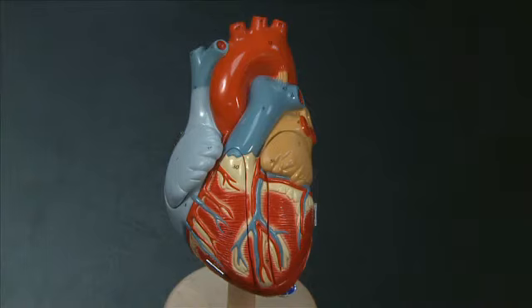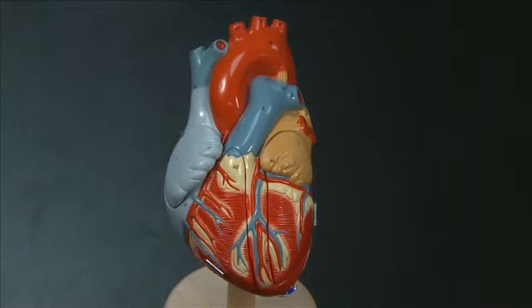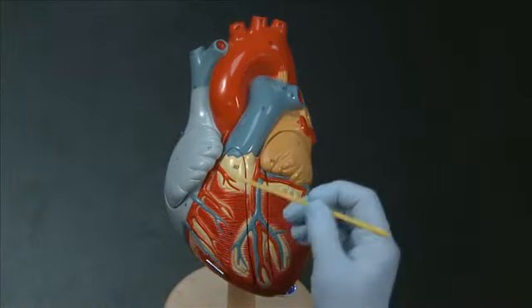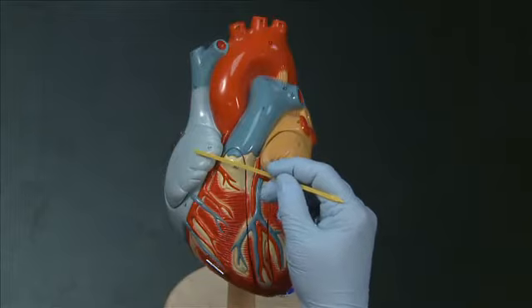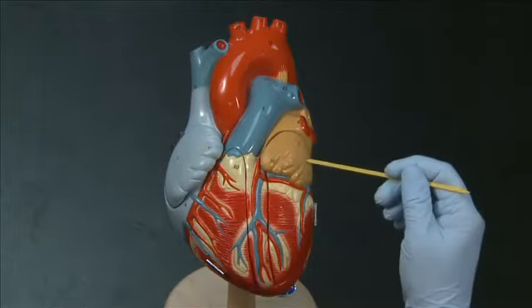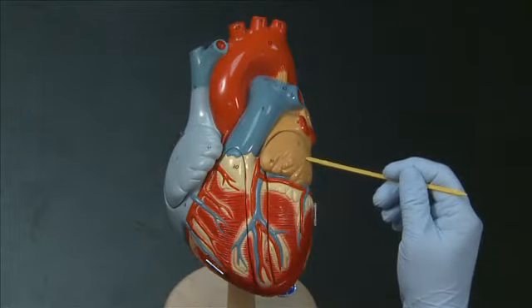One thing to note is that with the heart facing towards you, the right side of the heart is on your left, and the left side of the heart is on your right.